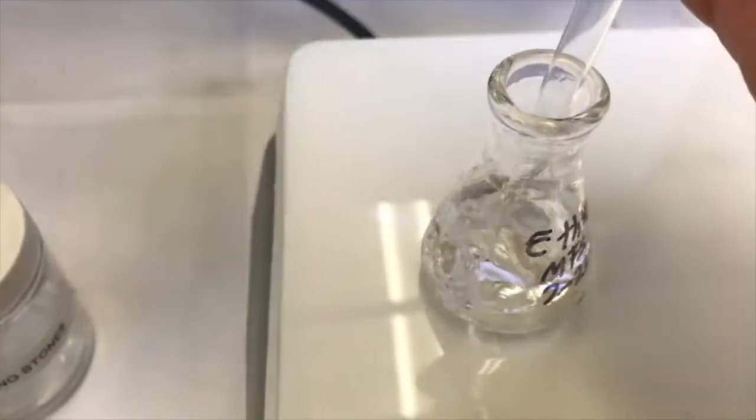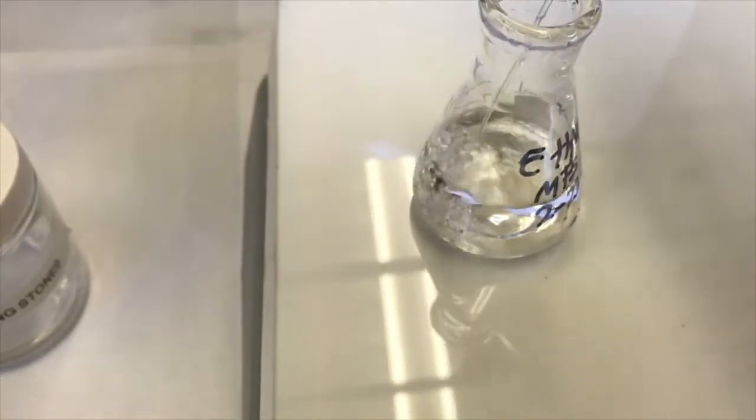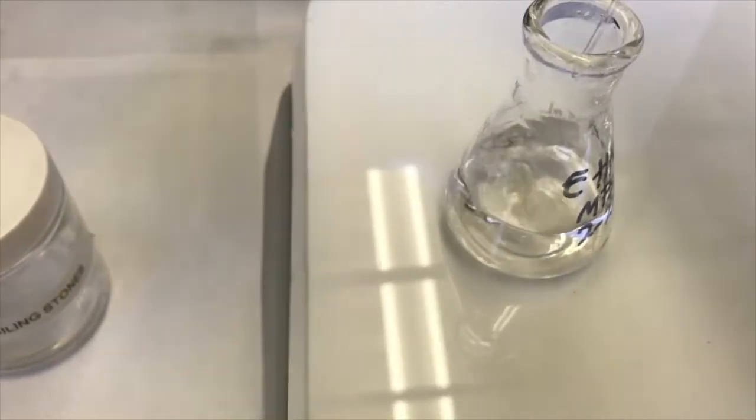So what I'll do initially is add some of this boiling ethanol to my impure solid off of the hot plate. I want to coat the bottom of the flask so that it has protection from a solvent in there. So here it goes. I draw some up, and I'm actually going to spit some out a little bit to really get this. I don't know how that works, but I think it's good to get the thing wet. It drips less. So I've got some ethanol in there, but I'm going to do a little bit more because this hot plate's pretty hot, and I want it to be good.